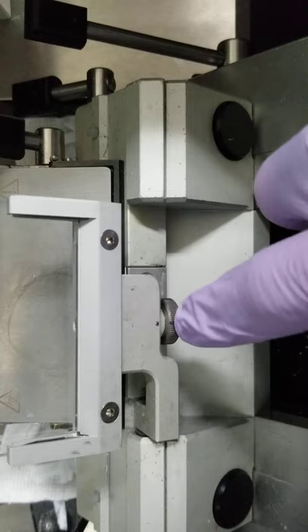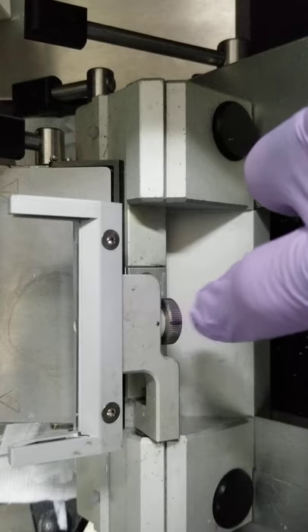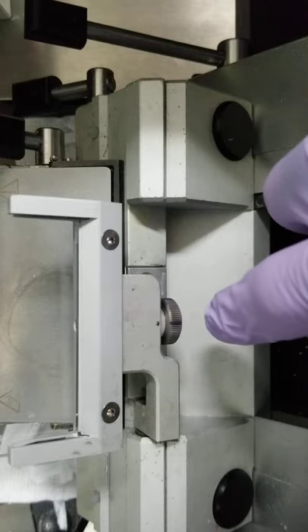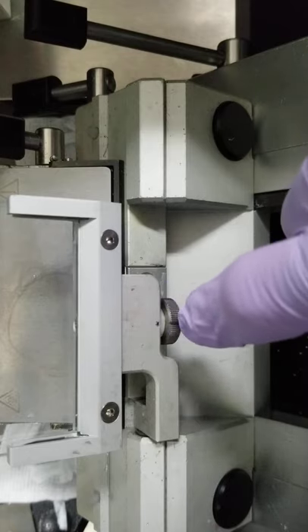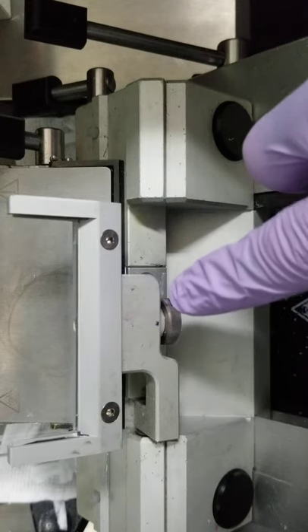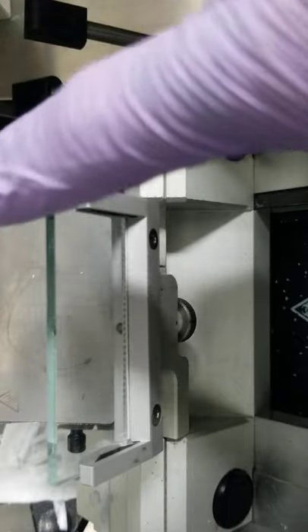once you get it set, you can put a little home position marker. I just use a little skin marker, just like they use in the room for marking specimens, or a lesion before they take the layer. It comes off with alcohol. Just put a little mark on your arm there for center, and then just line those up. Some specimens you have to tweak one way or a little bit the other way. But with the Avantik and Microm styles, these are actually very, very forgiving.